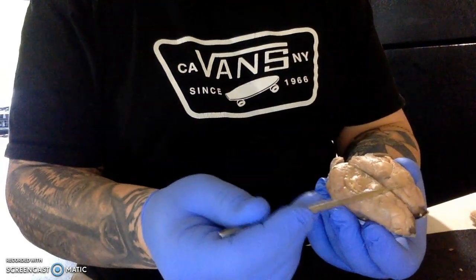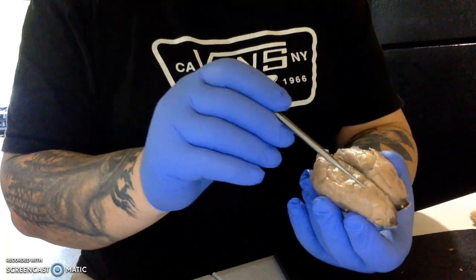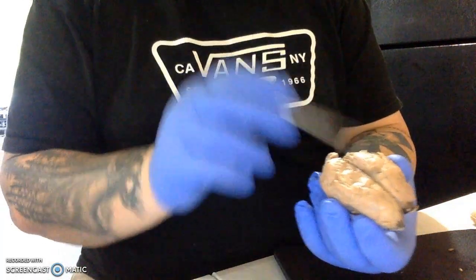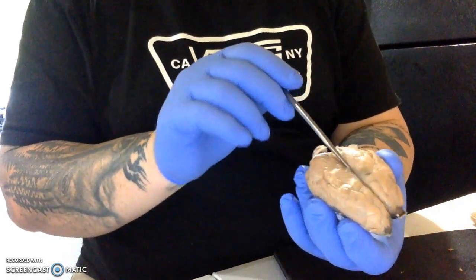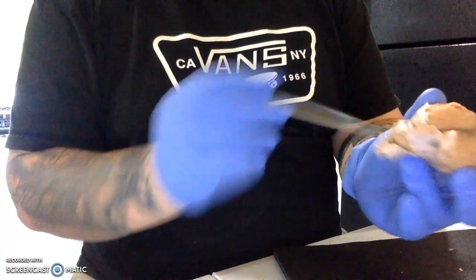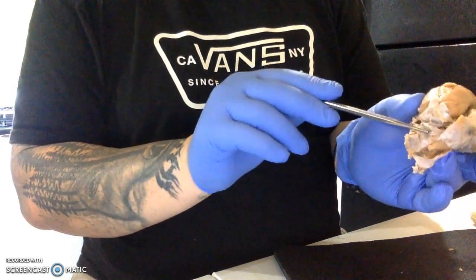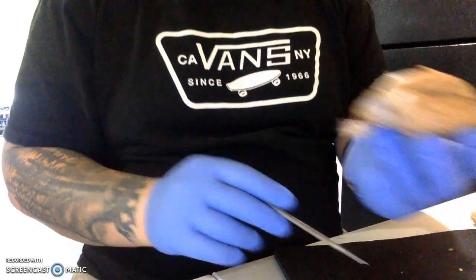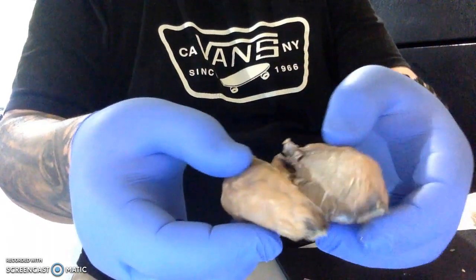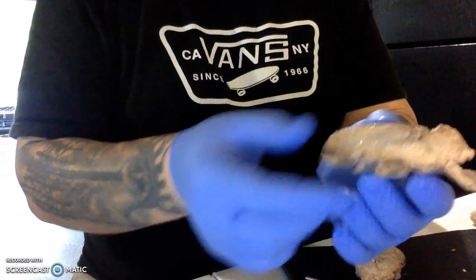There's these raised areas in the surface of the tissue that are known as gyri, and then the depressed areas that create these little almost like ravines are sulci. We had a longitudinal fissure that separated the two hemispheres of the brain, and then we had a latitudinal fissure that separated the cerebellum from the rest of the brain. Once we were done identifying those structures, we went ahead and made a sagittal cut straight down the middle of the brain to expose the inner parts.